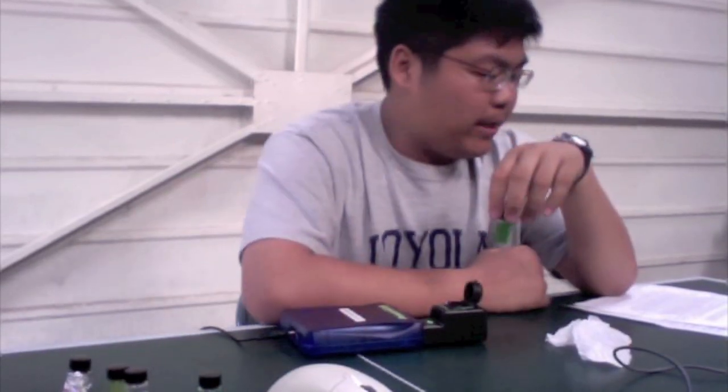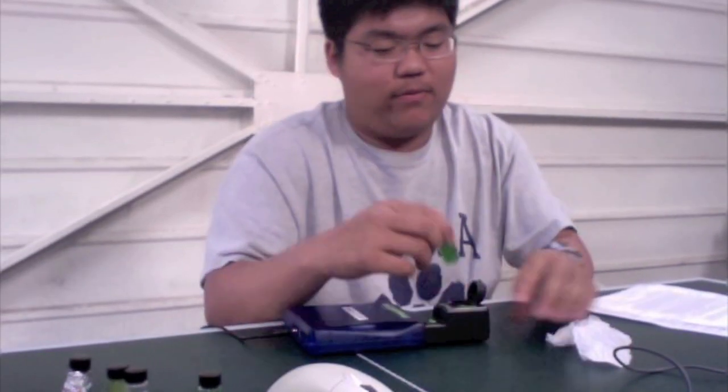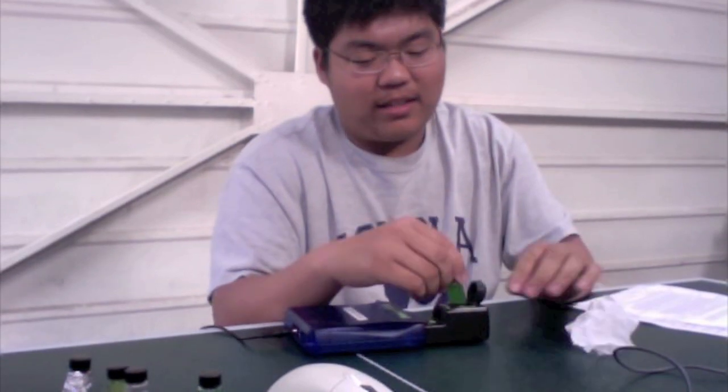sensor, turn on data collection for 5 minutes. Okay, so we're back, and this is cuvette 3, the unboiled chloroplast suspension in light, and there's DPIP, unboiled chloroplast, and master mix. So we put it into the sensor, close it, or wait, hold on. We wipe it, then we close it, put it into the sensor, start the run for 5 minutes, and we'll be back when 5 minutes are up.